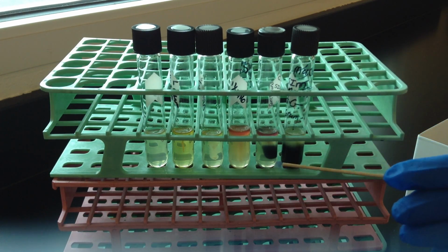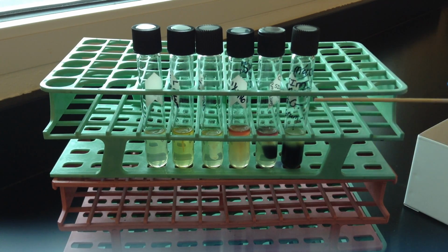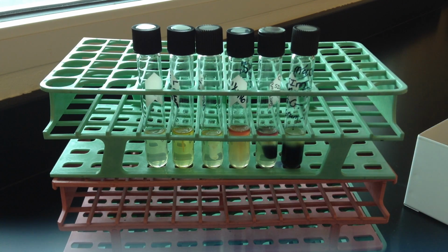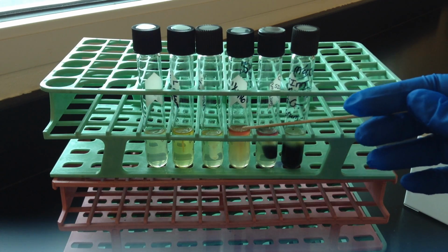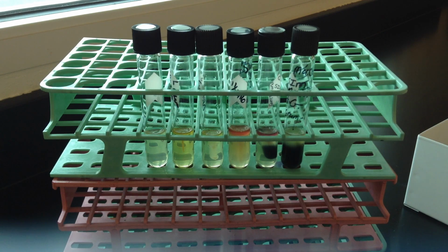So of those two, we would strongly correlate the indole production, the red ring, with an indicator of pathogenicity, and with the motility, because the organism has one or more flagella, it's able to move through host cell tissues. So that would be a tie-in with pathogenicity as well.